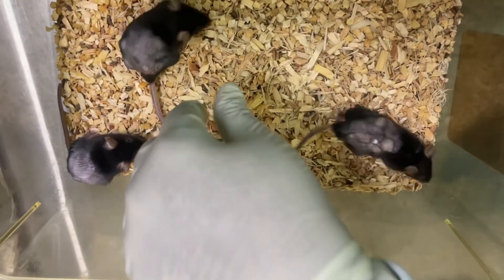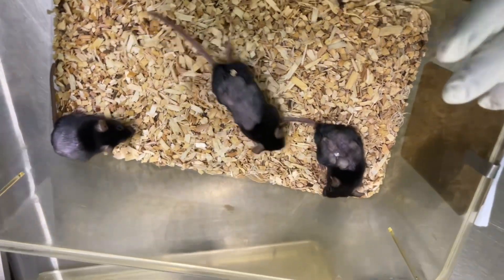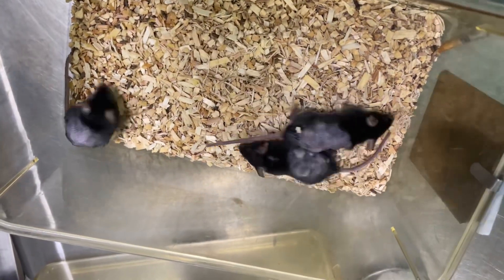Then put the mice back in the cage and observe them to make sure they are doing fine. Thank you.